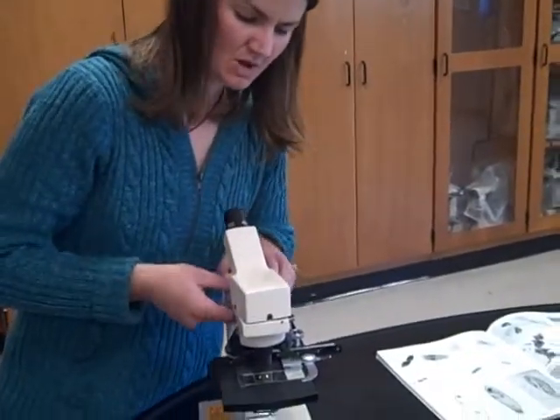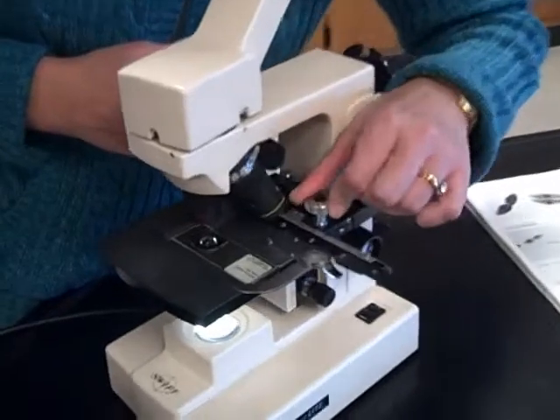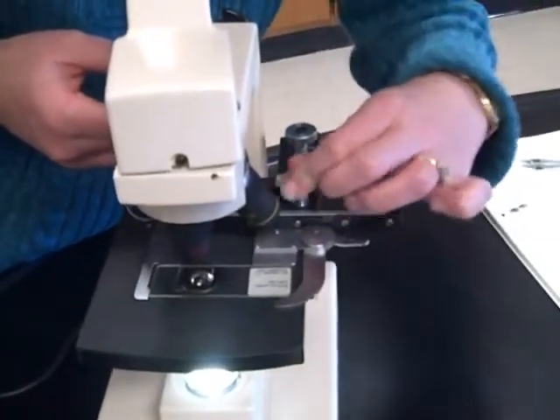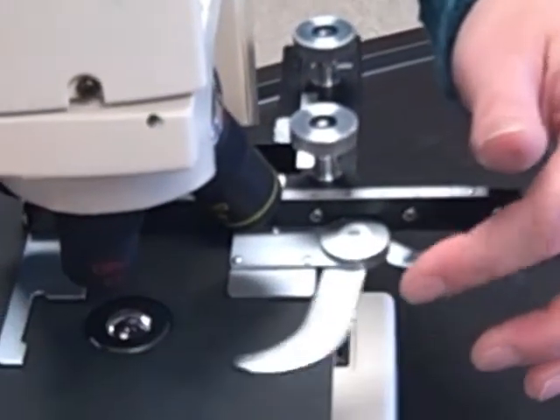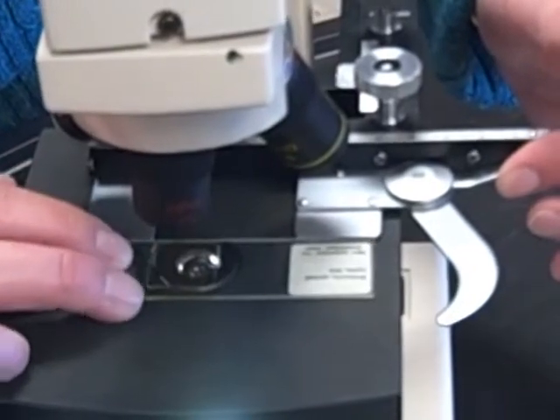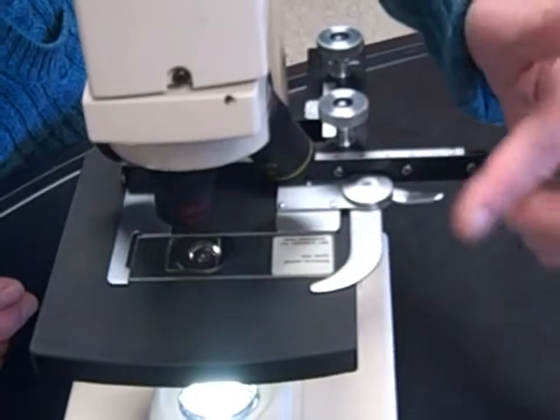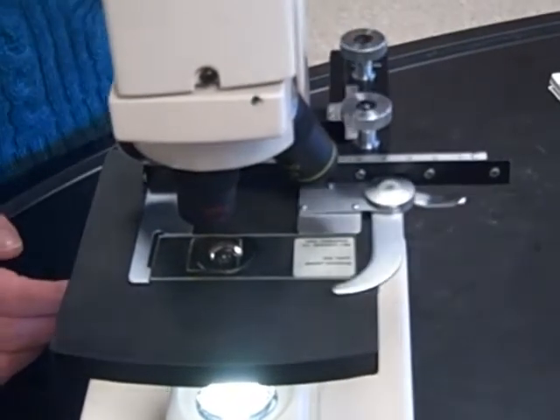One more thing I want to show you before we get started is the mechanical stage. You can move your slide around the stage by moving these knobs. Any time you have a slide on here, you want to move your slide all the way to the back of that part, clip it down — it clips just to the side of your slide, not over it, like the older stage clips.